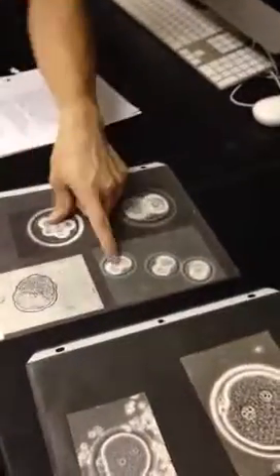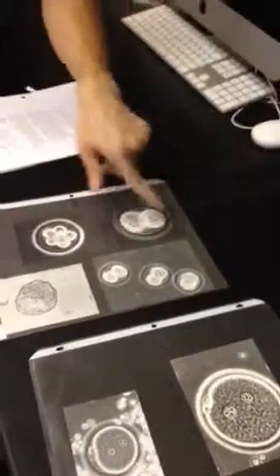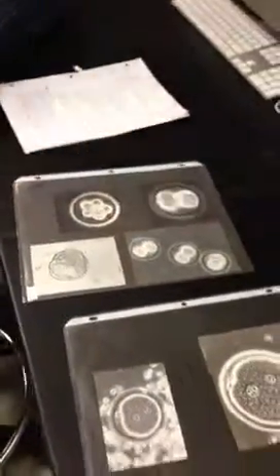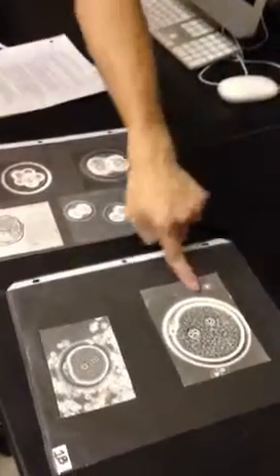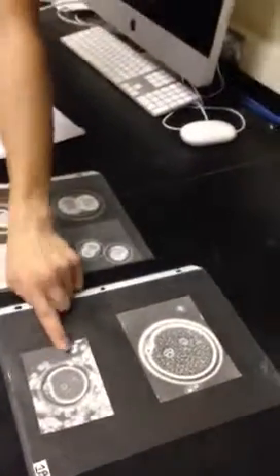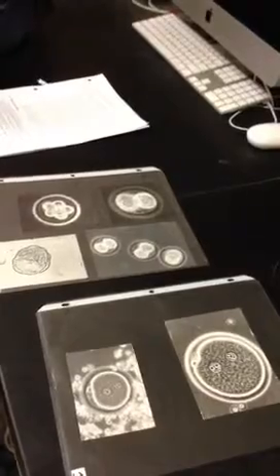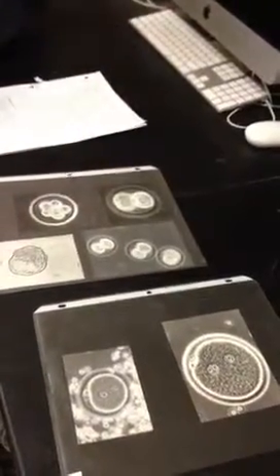Yeah, this might be the same exact picture. It might just be another embryo at the 2-cell stage. But here you can see the progression of it starting to split up, splitting more, and then you have really 2 separate cells. So would you ask us to put it in order? If I put D, A, E, C, and B, I think I missed A in there, and asked you to put them in order, something like that. I wouldn't ask about signaling molecules or time-wise when they should be happening, but just understanding if they're in order.